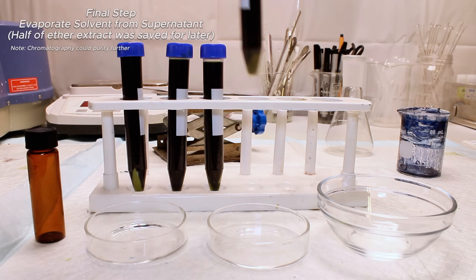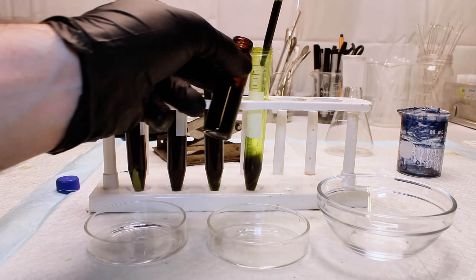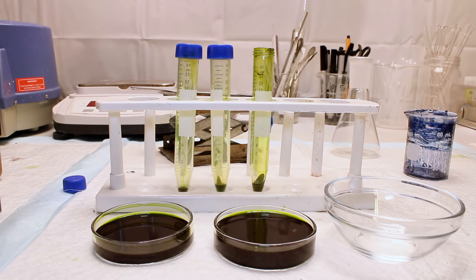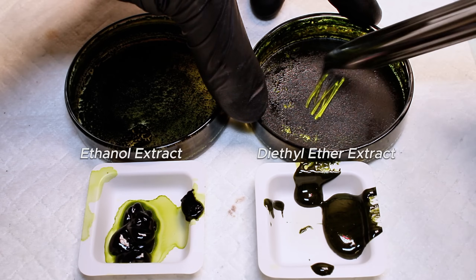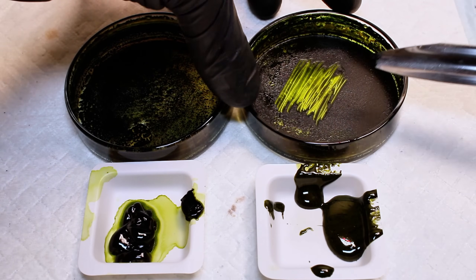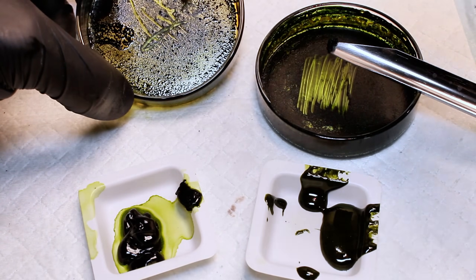After this process was over, I went ahead and transferred one of the ether samples to a vial for storage, and the other into a glass petri dish to dry. Both of the ethanol samples were transferred to a separate petri dish. If you check out the pellets at the bottom of the four centrifuge tubes, you can see that the ethanol left behind pale green, almost white pellets, while the ether left behind smaller dark green pellets. After leaving both petri dishes out overnight under a fan, on the right you can see my ether extract dish, and the weigh boat in front of it is everything remaining in the beaker that had refused to dissolve in the ether. On the left is my dried ethanol extract, along with the weigh boat containing everything that refused to dissolve in the ethanol. Ether did an immensely better job at dissolving chlorophyll, both quantitatively and selectively. The chlorophyll left behind when ether had evaporated was not oily at all and had a very uniform color. It was also a visibly larger quantity, despite half of the ether extract going into storage.